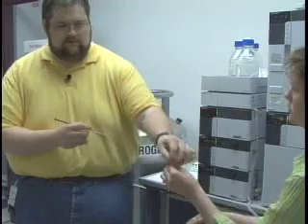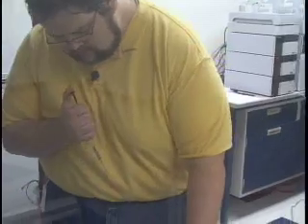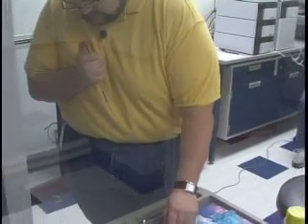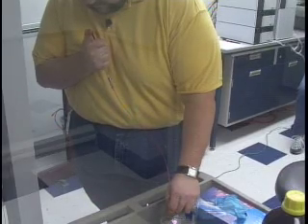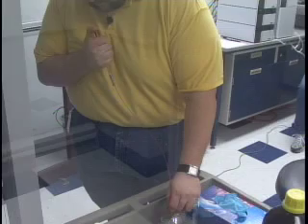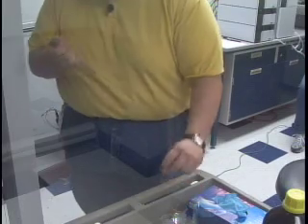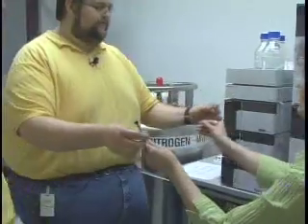This won't be too high. How do they mix it? In the syringe. He turned it up. Would you like to double check it before we do it? No. Okay. Thank you. Welcome.